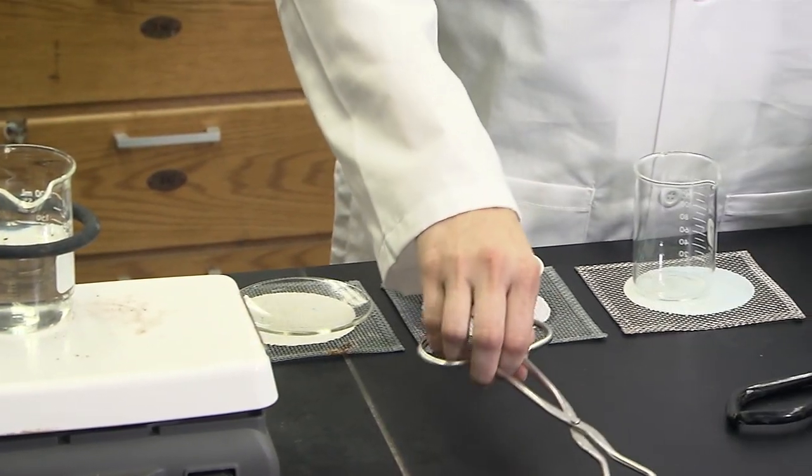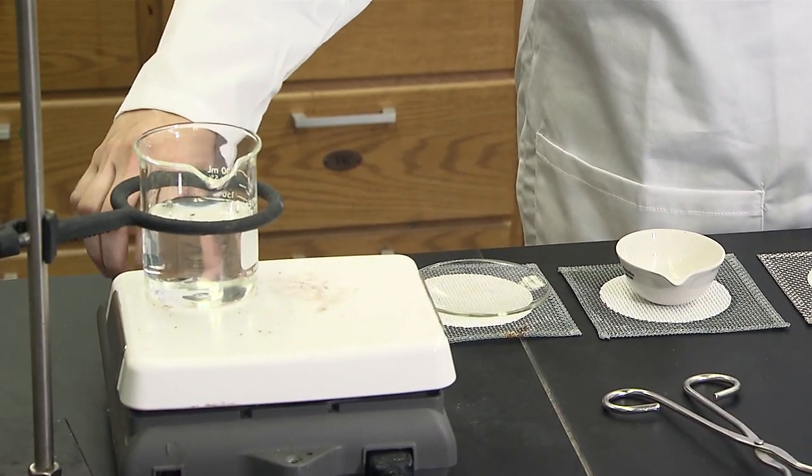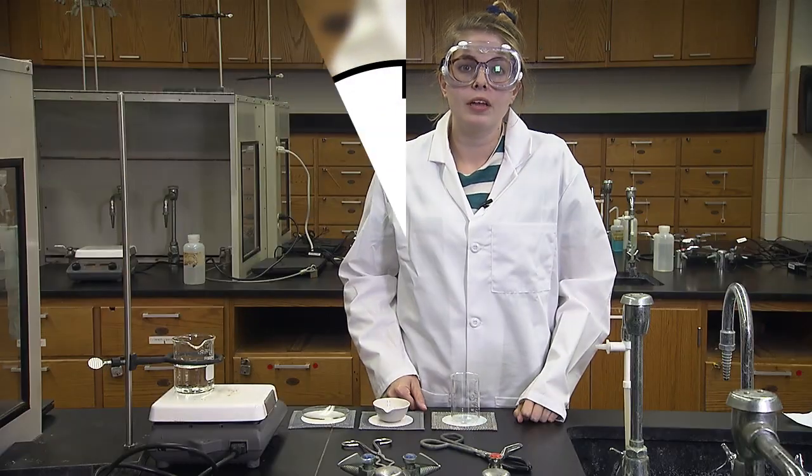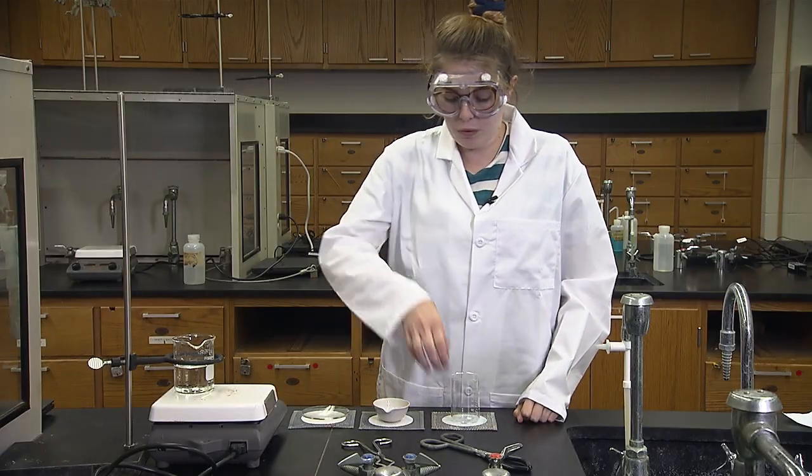When you are finished with the water bath, turn off the hot plate. Allow it to cool before emptying the water.